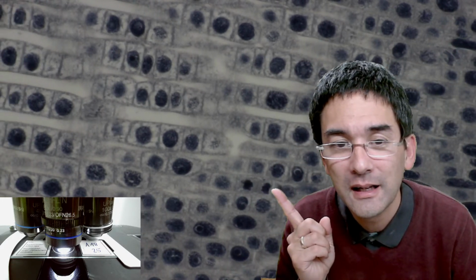Look what I found here. Do you see those two? Those two over here? That is telophase. I know that because the two nuclei look very similar, and you've got to watch very carefully. But maybe you can see a faint line between the two nuclei, a very faint line. This is where a new cell wall is being formed. It's called a cell plate.